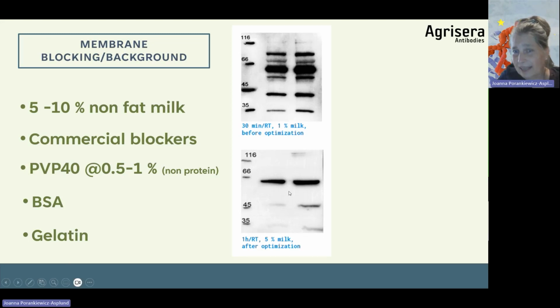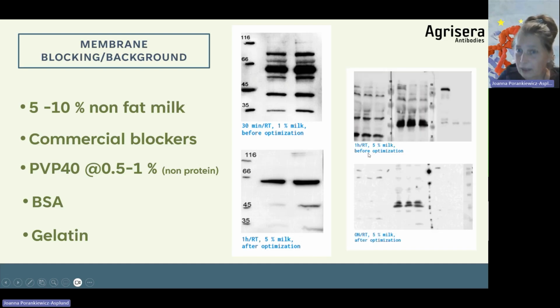And here you can see an example of how it worked. So more unspecific binding places were blocked and a better signal-to-noise ratio was obtained. And this blocking was done at room temperature. But in some cases, we may need to block overnight, as in this example. So blocking has to be adjusted to the specific protein-antibody pair, because sometimes it is enough to block at room temperature, but in some cases, overnight blocking is required.